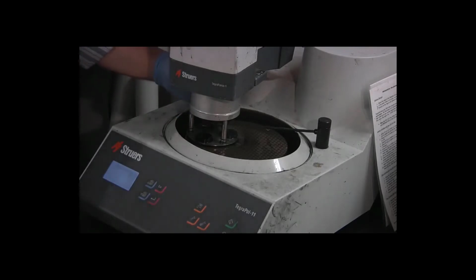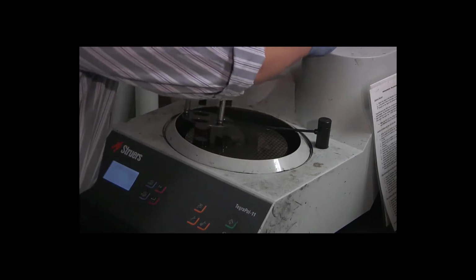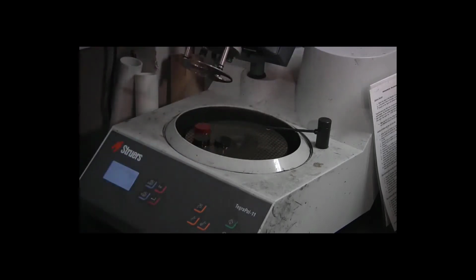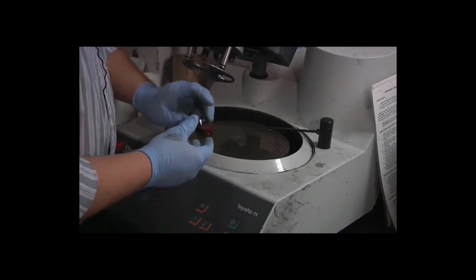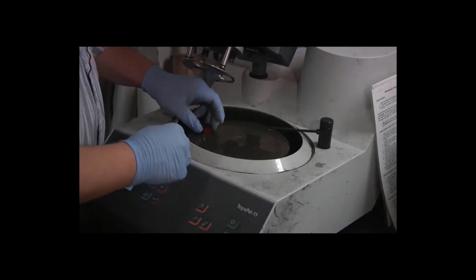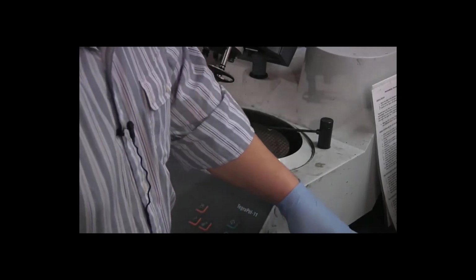Okay, you may notice that occasionally, if the specimen is wet on the back, it will stick to the piston, and when the unit is done and withdraws those pistons, it lifts the specimen up. That's just a minor annoyance. So now, the goal of having done that first grinding step several times is to minimize the chance that we need to do the remaining steps again.